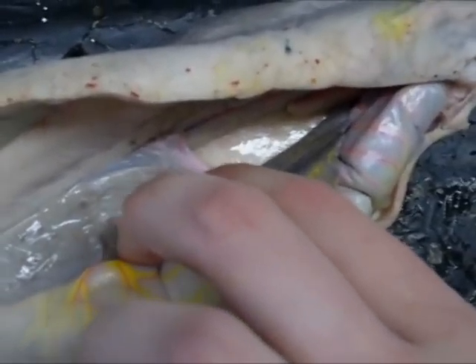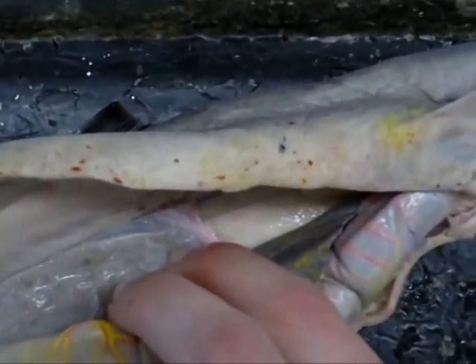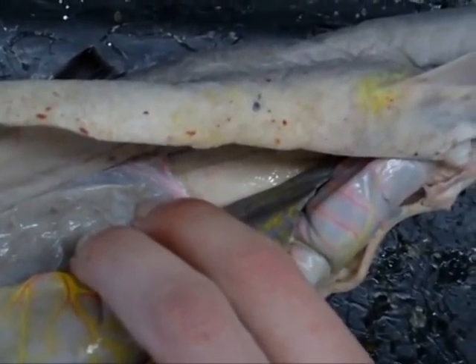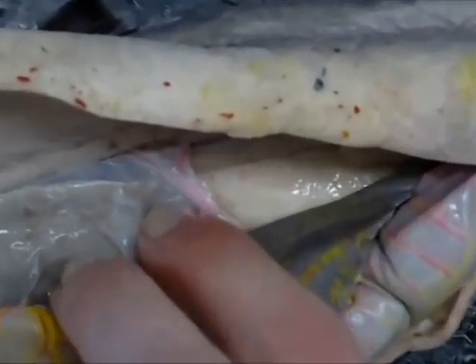The mesentery. We need to find the vessel that leads to this. This structure that travels along the whole back is the dorsal aorta.